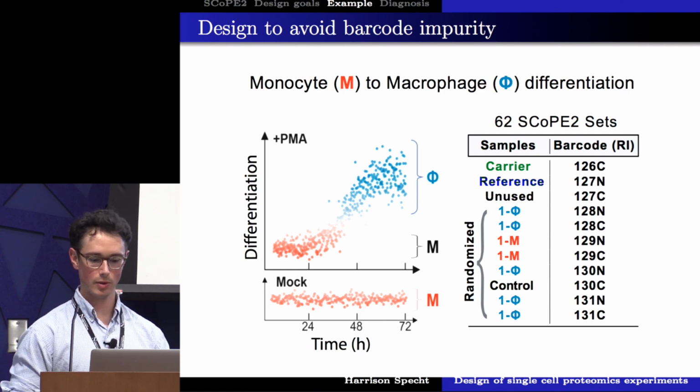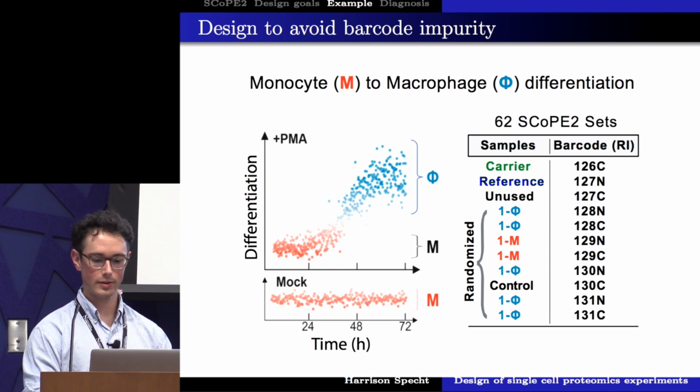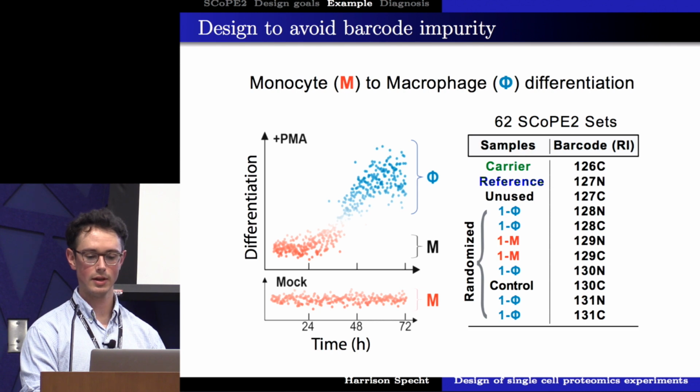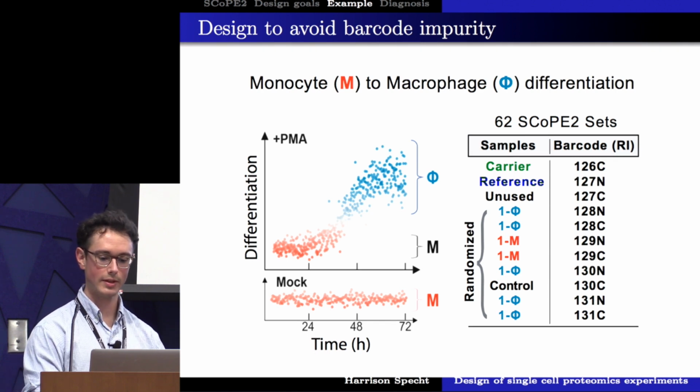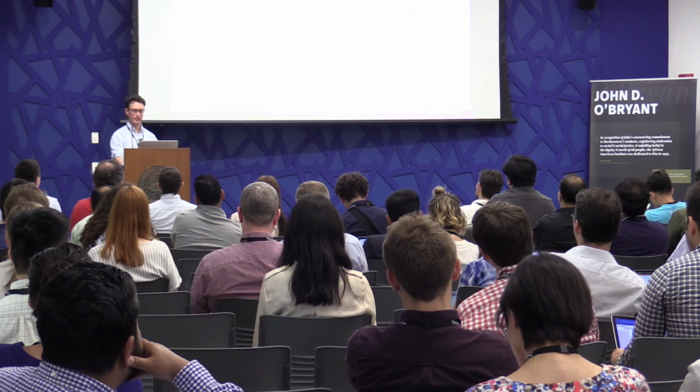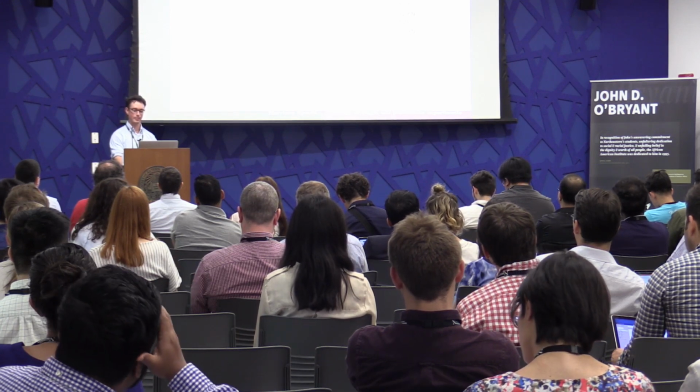Now, this is sort of a good moment to stop and talk about one of the potential artifacts that can be introduced in SCoPE2. Now, these commercial barcodes that we use are amazing, but they do have some carryover and contamination into adjacent channels. About 1% of all the signal coming from each barcode carries over into adjacent channel. That's not a problem when the signal in each of the channels is pretty similar to one another. But when you have something like the carrier that's way more abundant, just 1% carryover into an adjacent channel would completely swamp the signal. So therefore, we leave the adjacent barcode to the carrier channel empty.